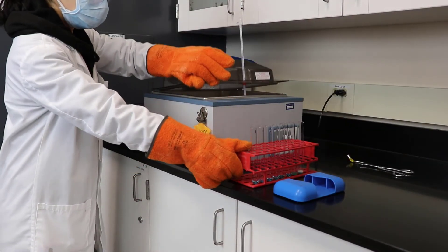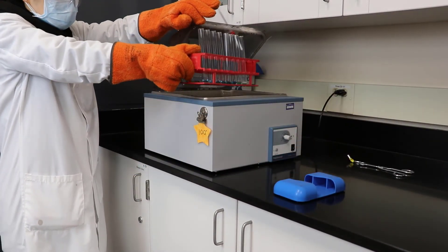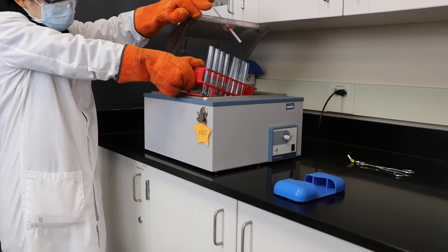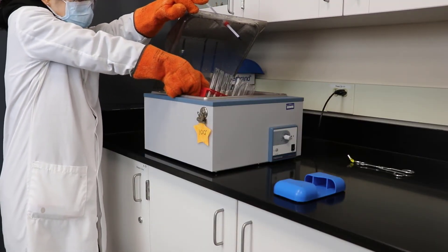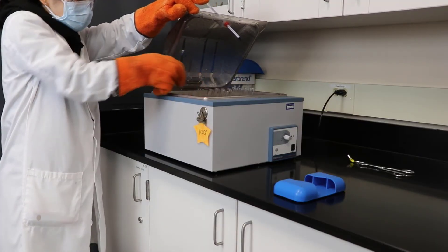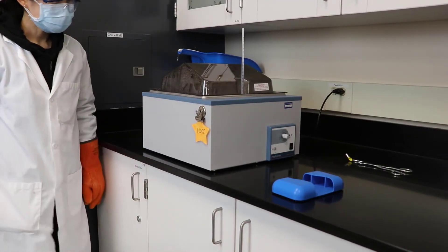Carefully place the entire test tube rack into the 100 degree centigrade water bath for 3 minutes. Be careful — it's hot, so use hot mitts.